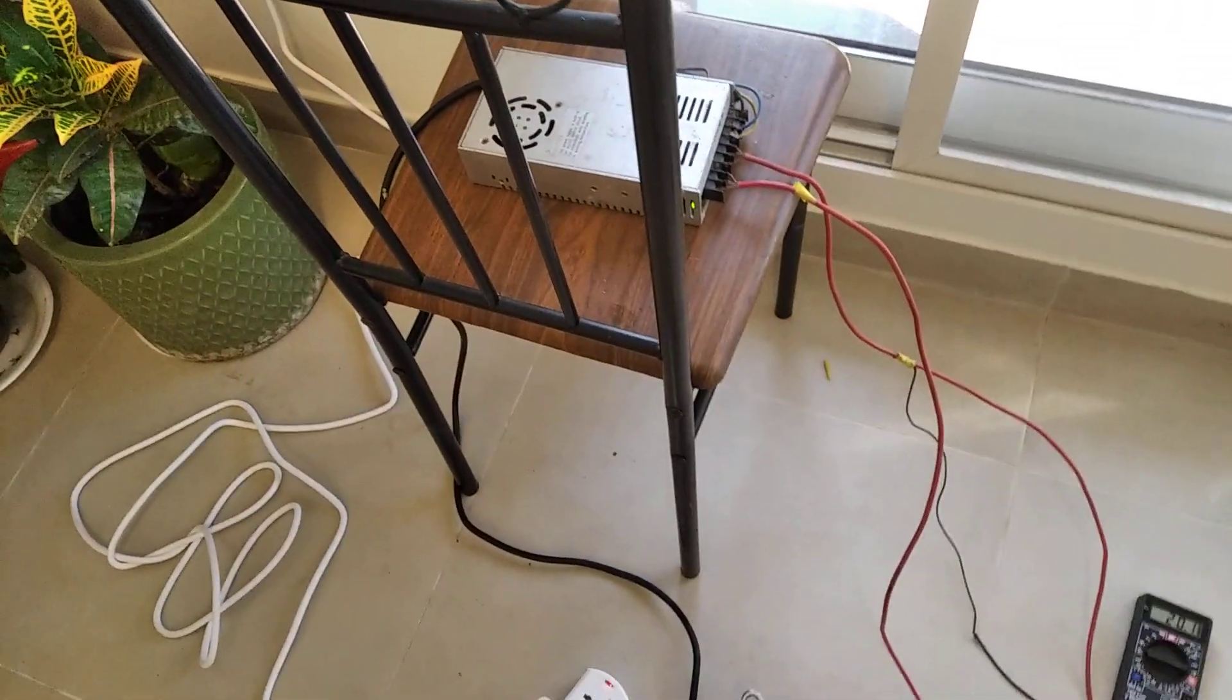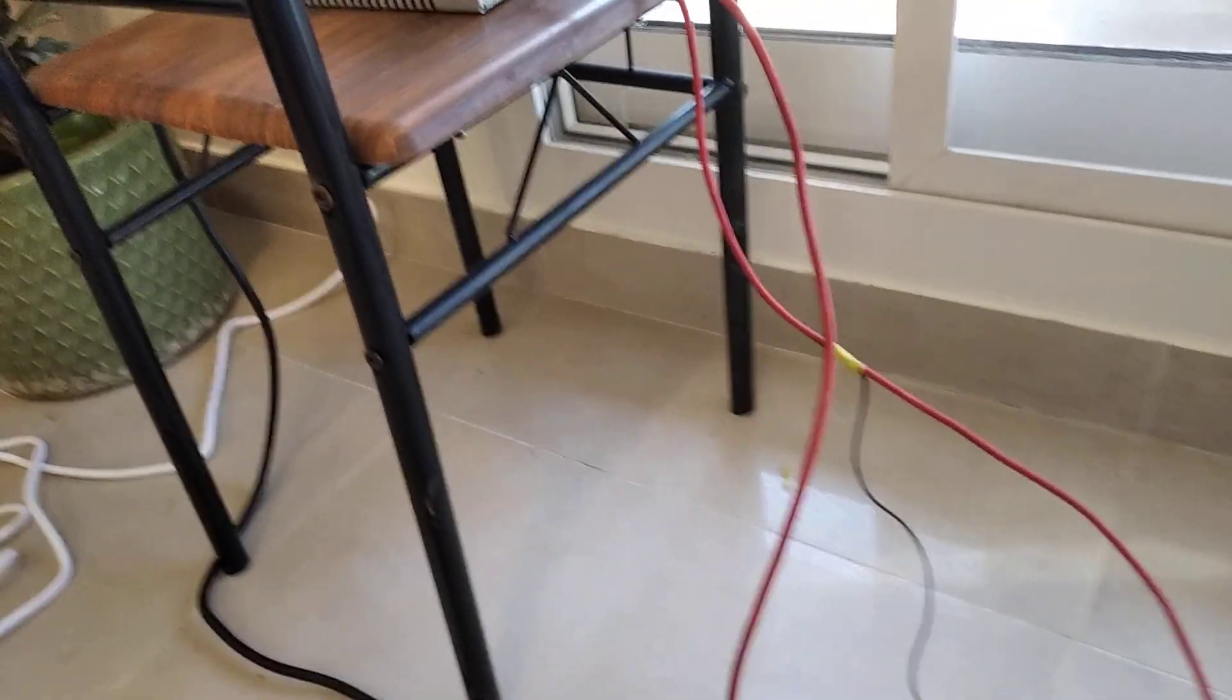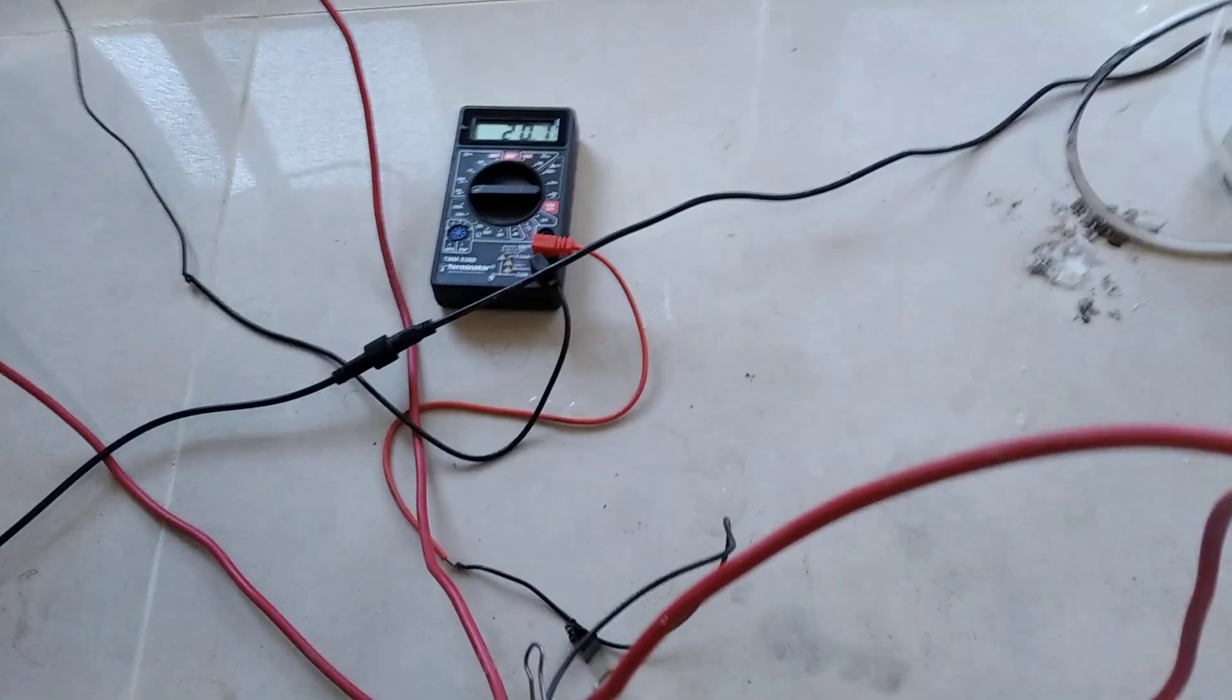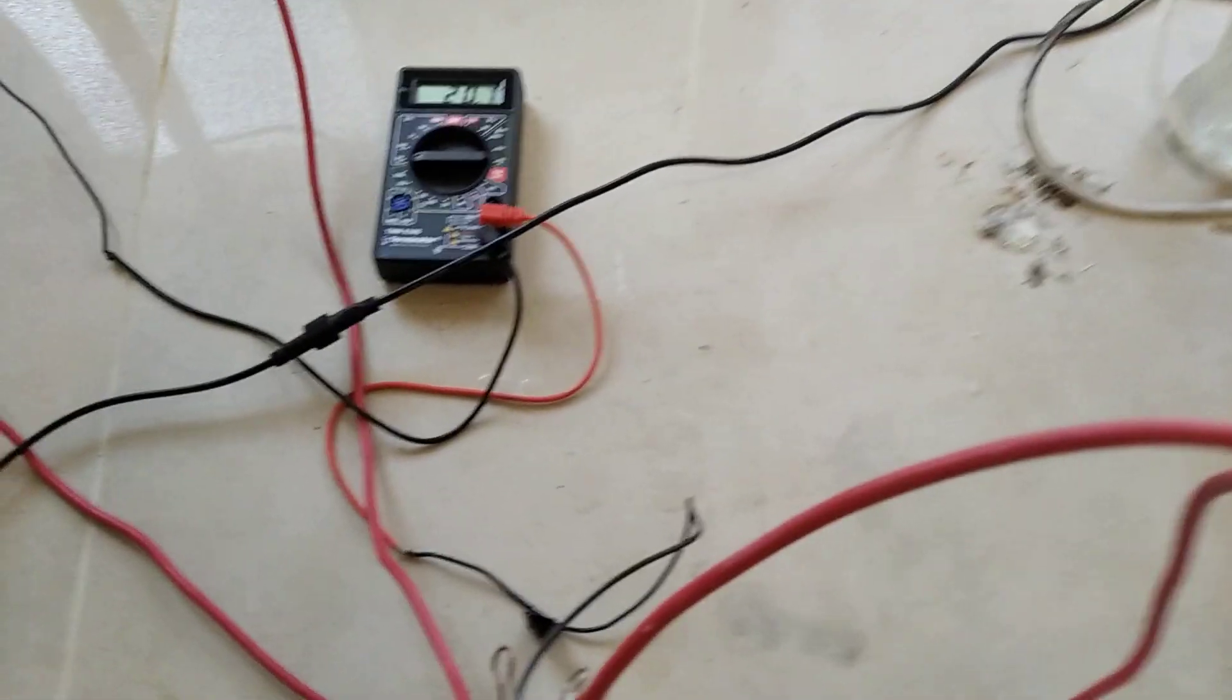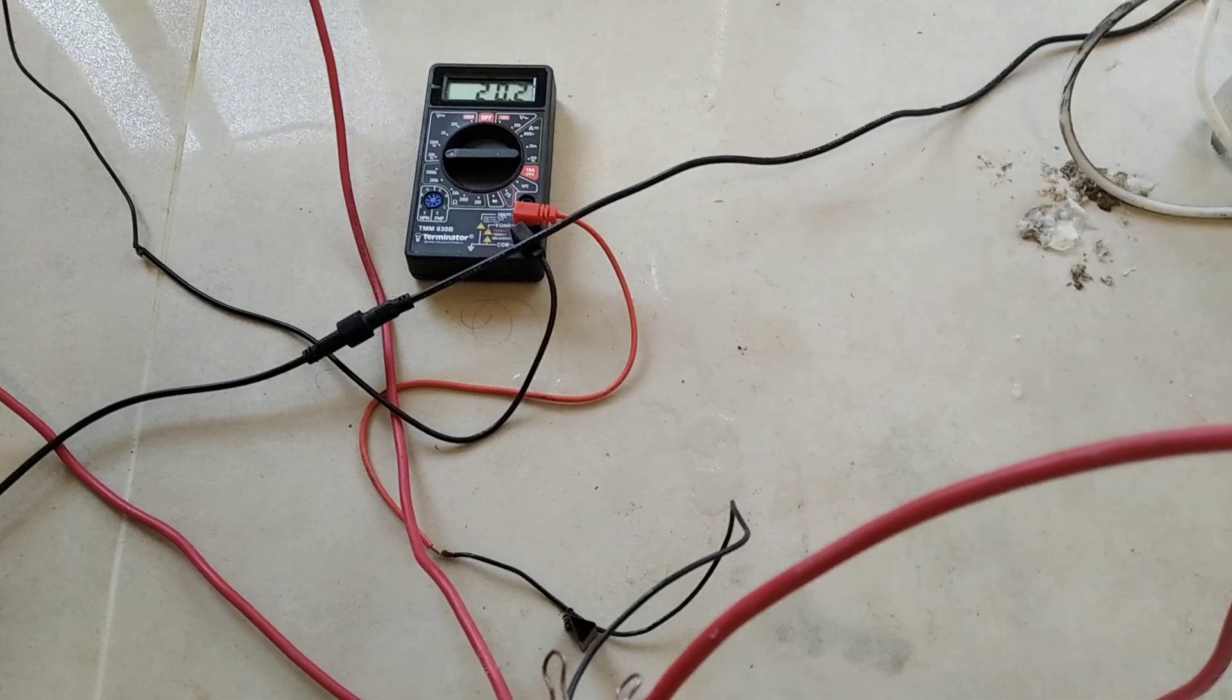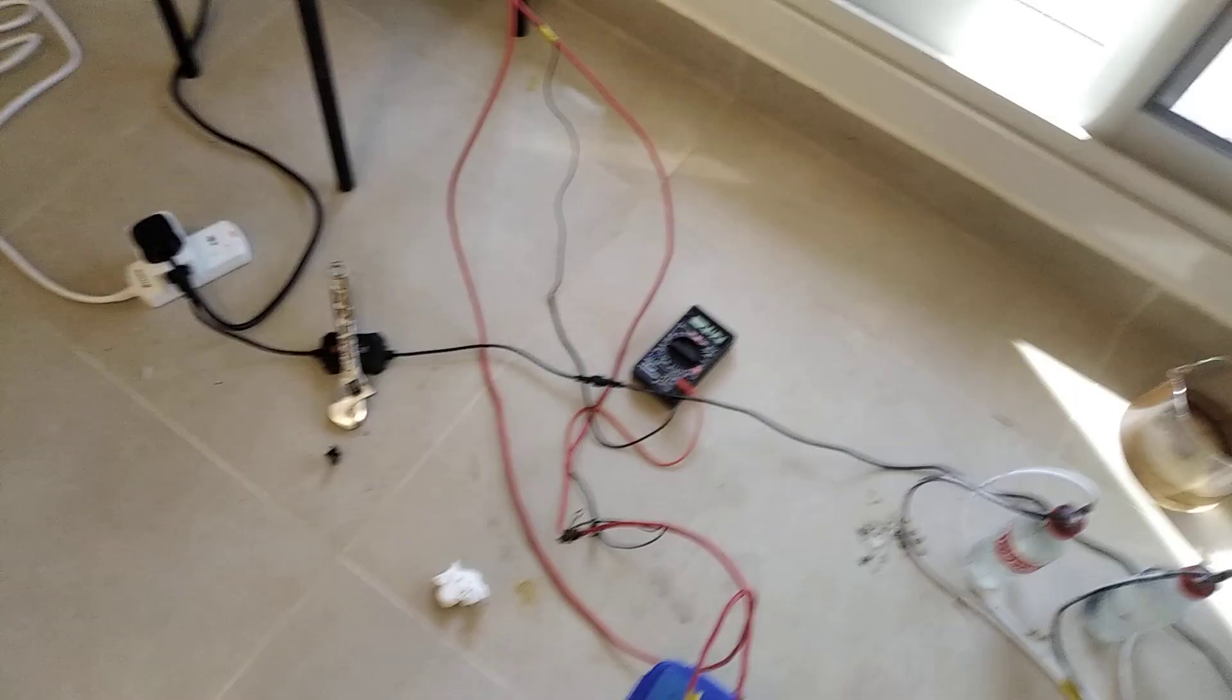Power supply using the same old 5 volt 50 amp capable supply. Right now I'm only running at around 8 amps though, I'm not gonna go any higher than that. You can divide this number by 2.4275 to get your current, which I do. That's using a shunt between two points. The same exact setup as my chlorate cell except I'm using it for this.